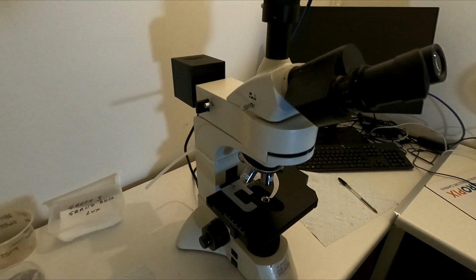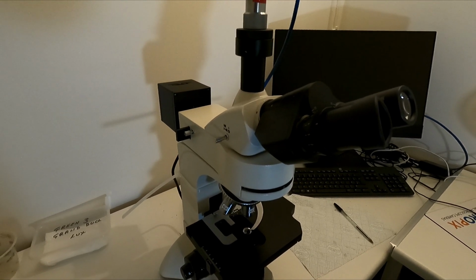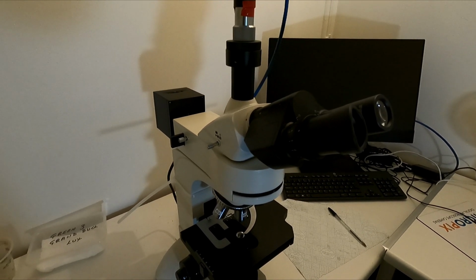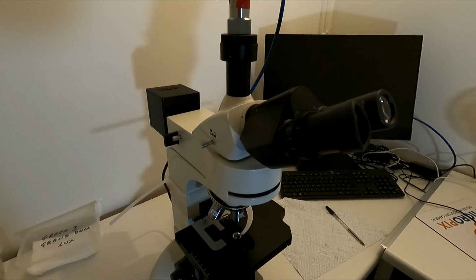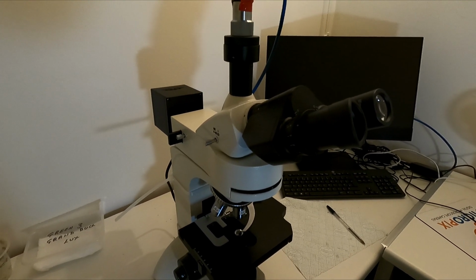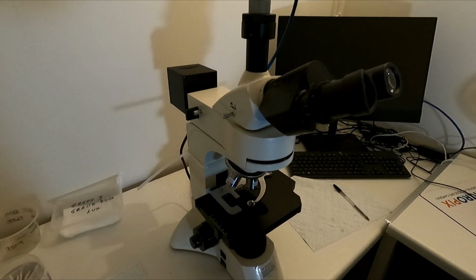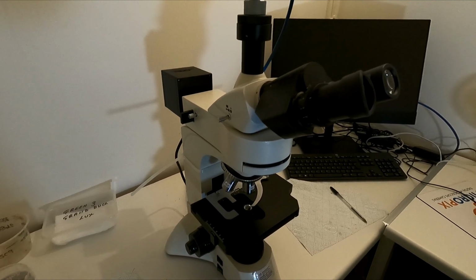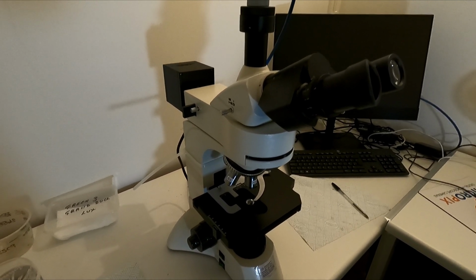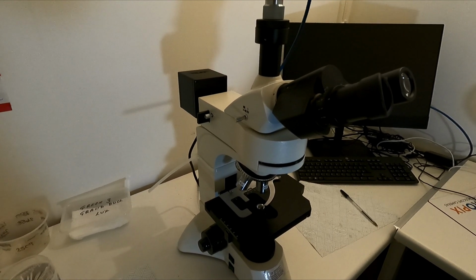So all the glassware, all the preparations that we do by the sink, the cleaning, the different reagents and chemicals that we use, gear us up to preparing a slide that we can put under this microscope and look at and count and identify with the human eye, and that's what gives us the analyses that we deliver.